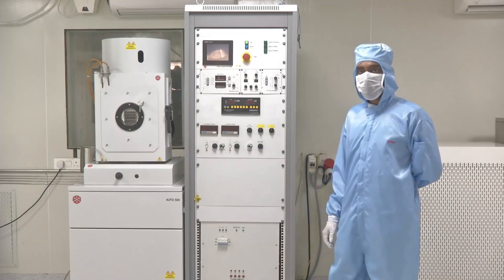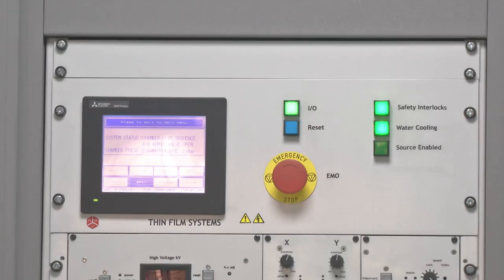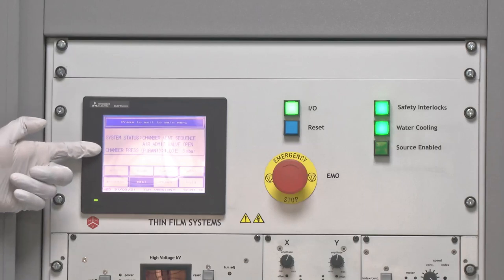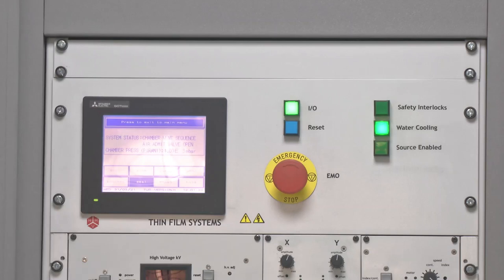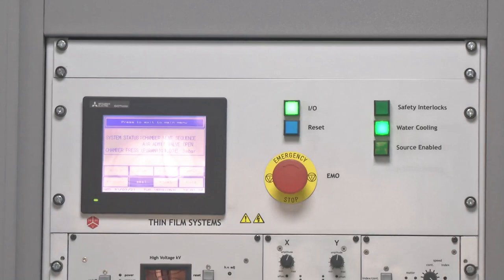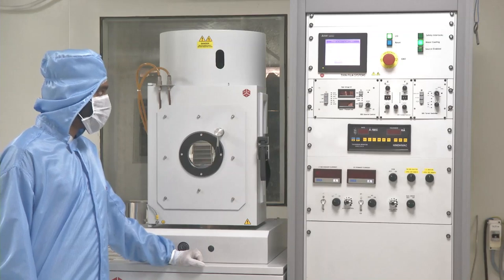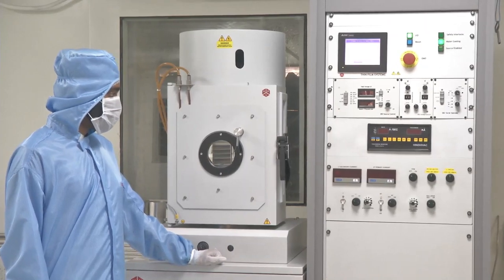After switching on the main switch, we turn on the system and its display unit. The chamber has been vented, which can be seen from the pressure display — once it comes to almost atmospheric pressure. As soon as we open the chamber, the first thing we notice is that the safety interlock is turned off, which means it is now safe to open the vacuum chamber.